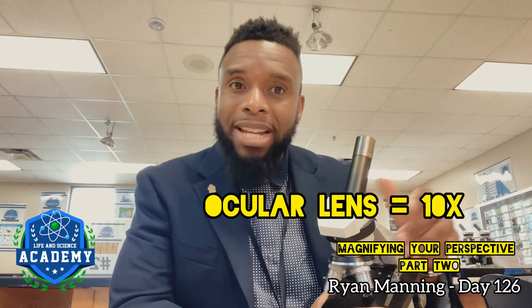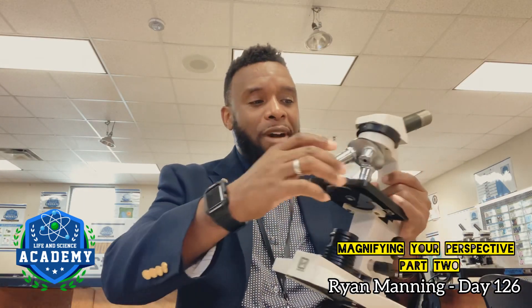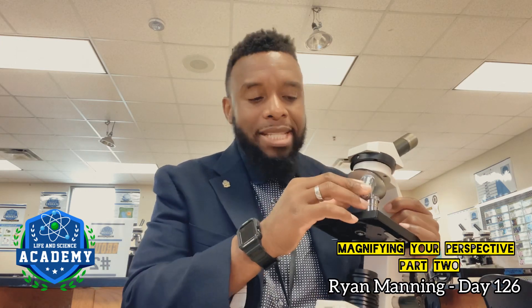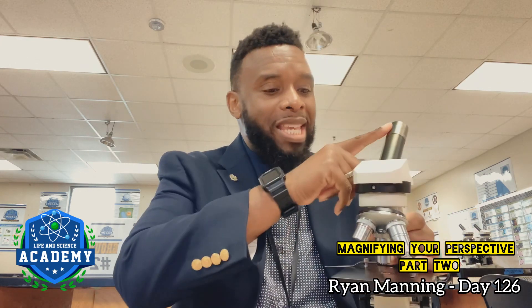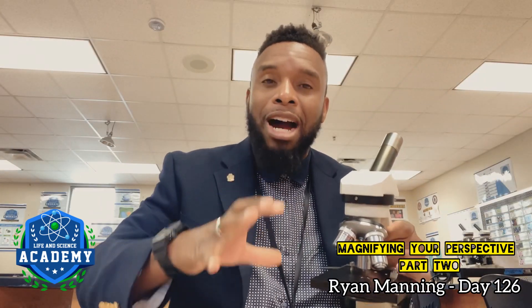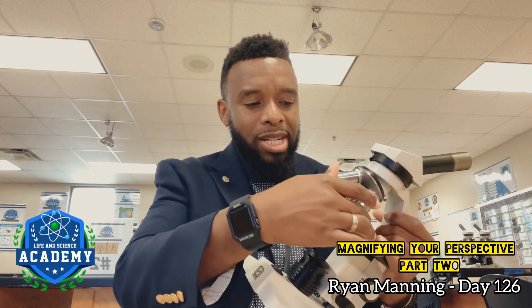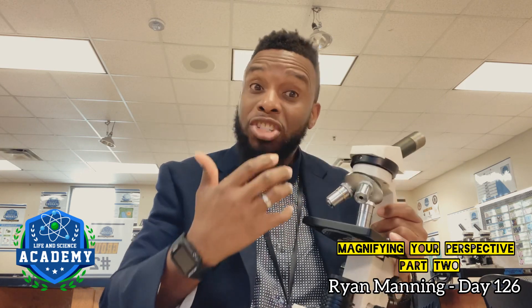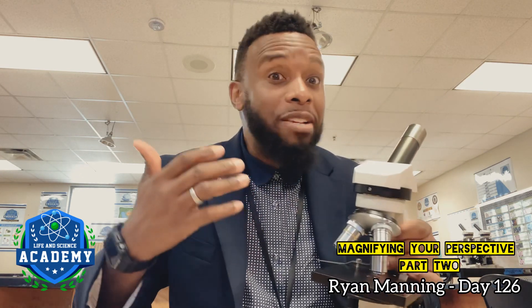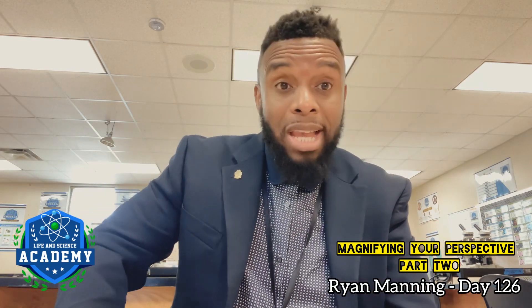This ocular lens magnifies whatever I'm looking at 10 times. If I go to this low power lens, which also magnifies the specimen 4 times, 10 times 4 means overall I'm looking at 40 times. The medium one is 100 times. And the high power will magnify whatever I'm looking at 400 times.